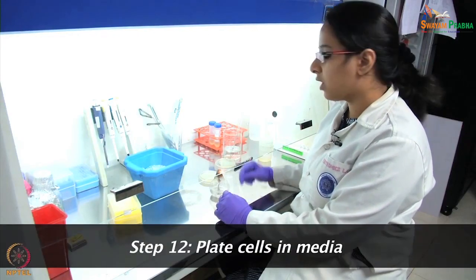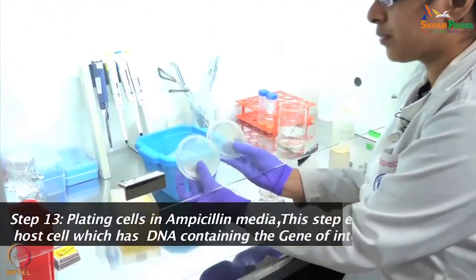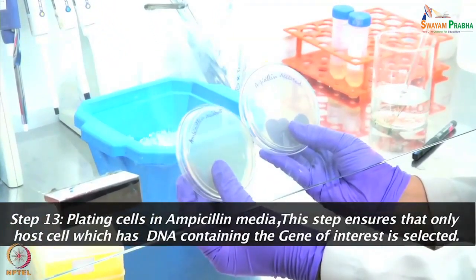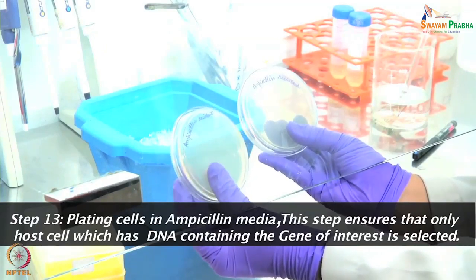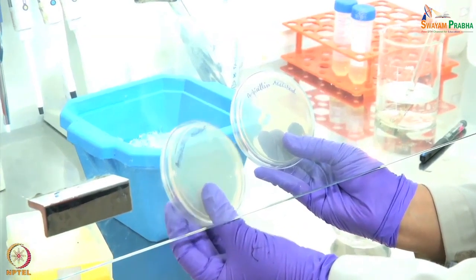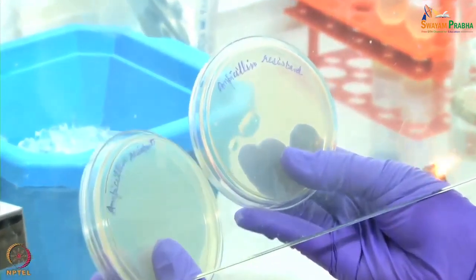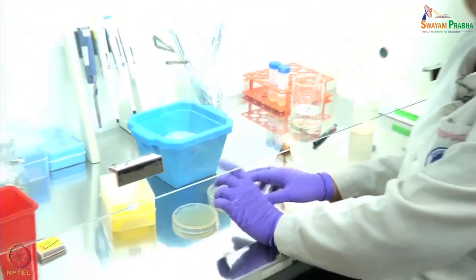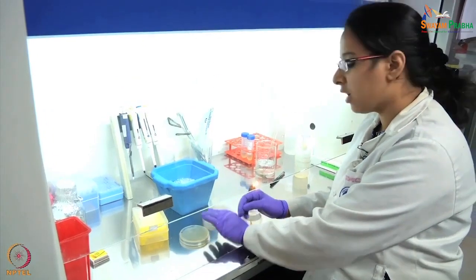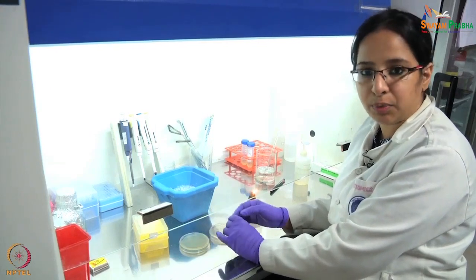Now we will perform the plating. As you can see, we already have LB agar plates. These plates have all the components which will help the bacteria to grow. Additionally, we have added the antibiotic ampicillin, because our vector — the plasmid DNA — has an ampicillin resistance gene. So when we plate our ligated product onto this, only those colonies which have our vector will show up. For one plate I will use the ligated sample that has been transformed into the DH5-alpha host cell; for the other plate I will use the negative control.